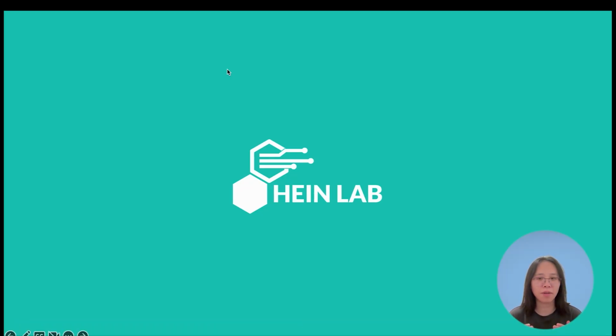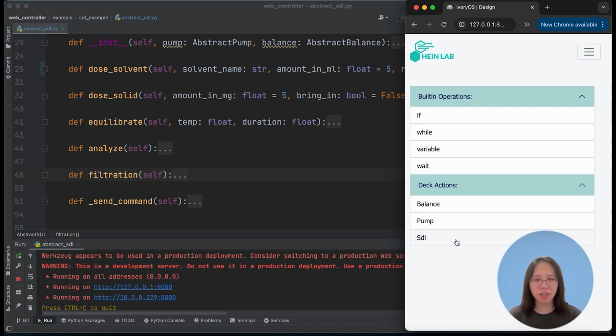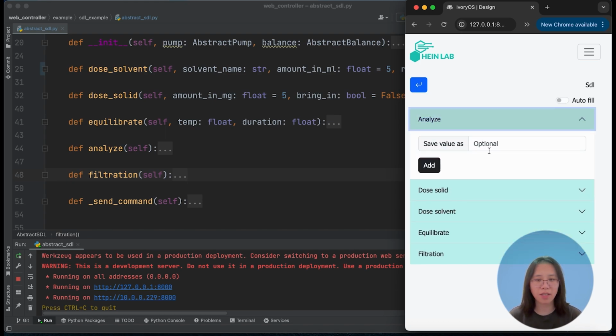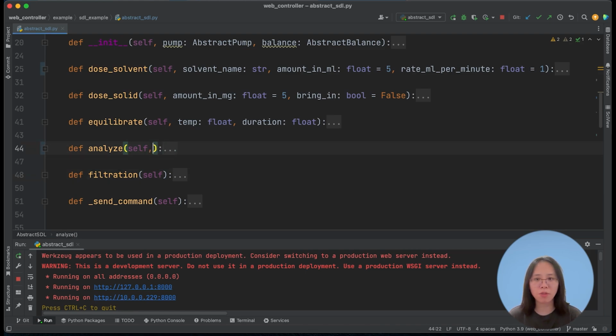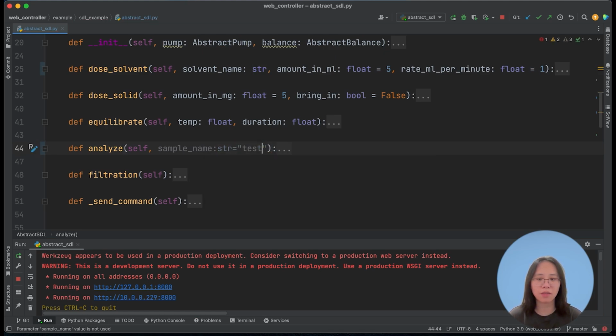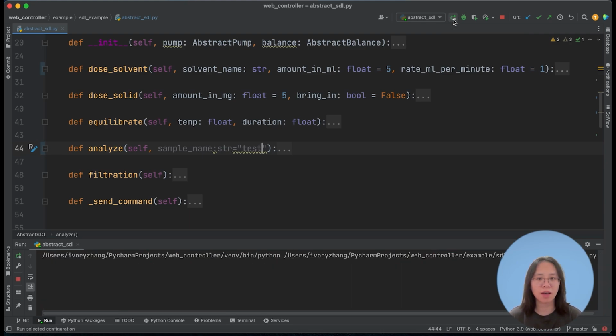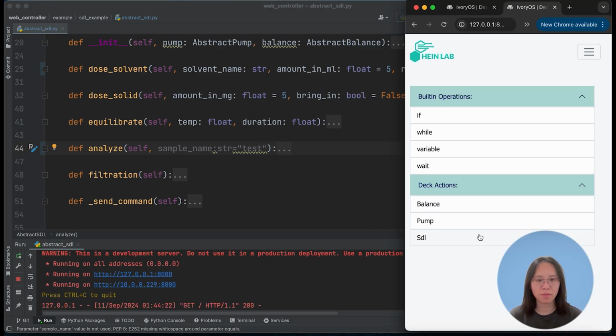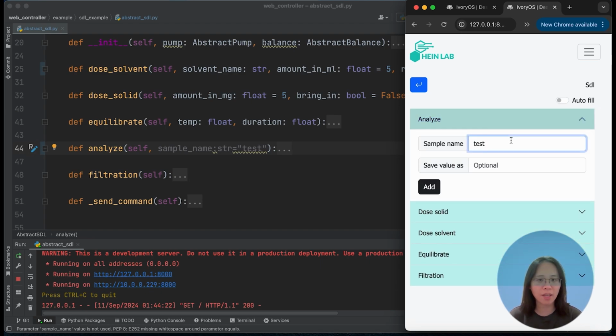In this last example, I will demonstrate how we can capture all the changes that are happening in the Python script. So back to the design page, we can see the analyze function. It doesn't take any parameters. If we want to change this function by adding one parameter, for example, we can add sample name, and this is a string value, meaning it's just a text value. We're also going to set a default value, saying this is test. And we're going to rerun this web app. Now, as you can see, when I click the analyze function, there is one parameter added to the web form, which is the sample name with the default value being test.